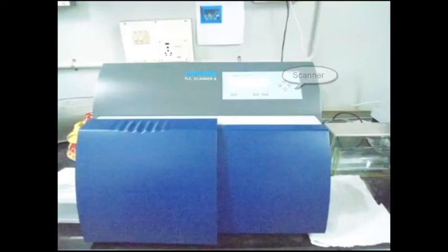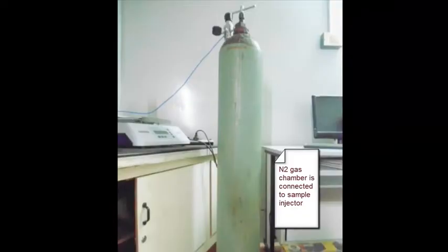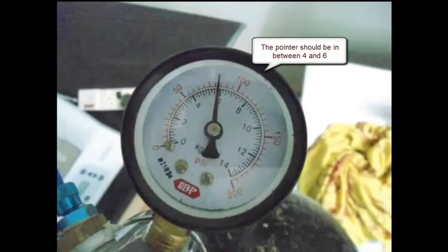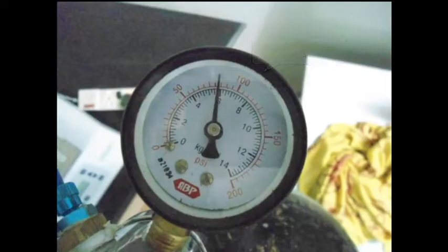Then the nitrogen gas chamber, which is connected to the sample injector. This pointer should show the pressure between 4 and 6 for effective sample loading.